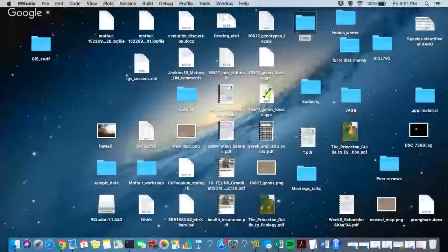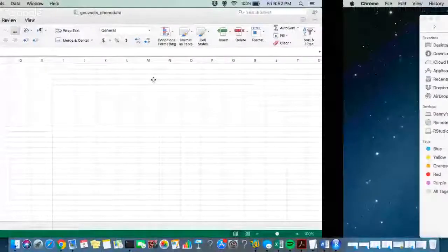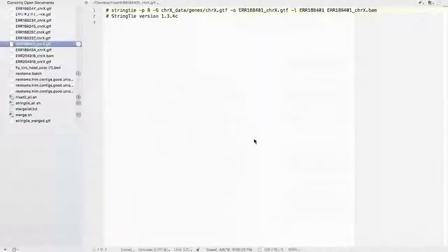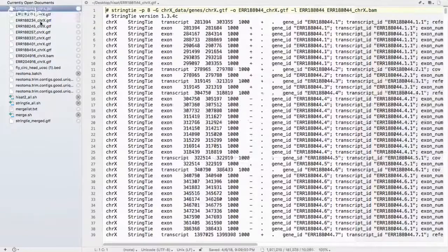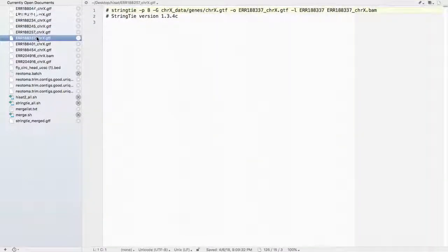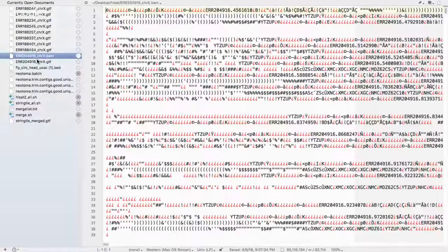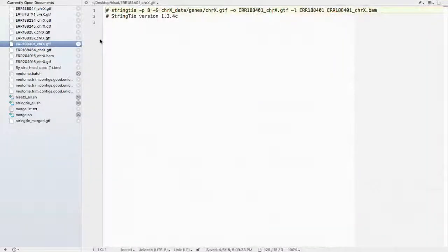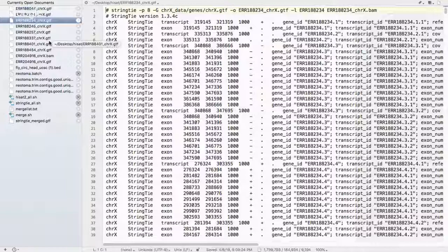Alright, I have worked through the rest of the HISAT protocol. I had some issues. So you can see here, I've created these GTF files, but I don't know if it was an issue in the way I downloaded or what, but only the first four had data and everything else was empty. So the analysis I did after this is just with the first four, but it's still enough to do some of the comparative analysis in R.